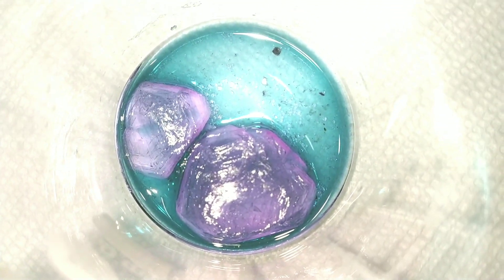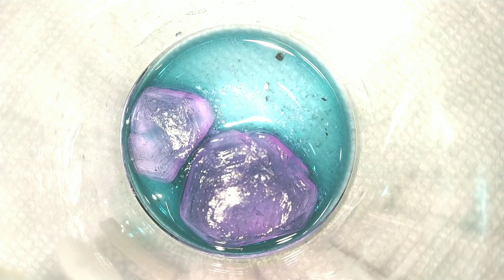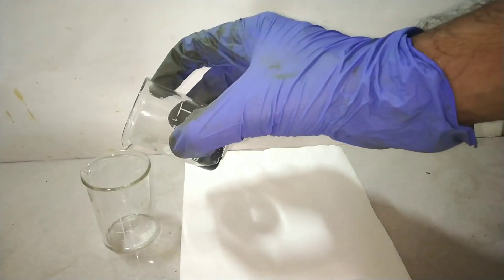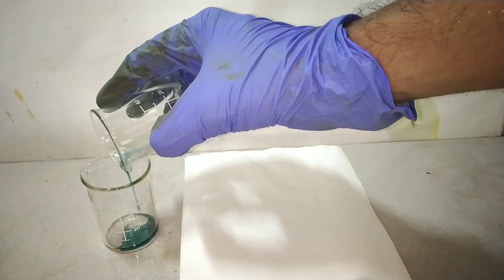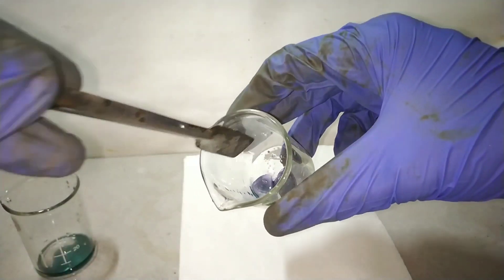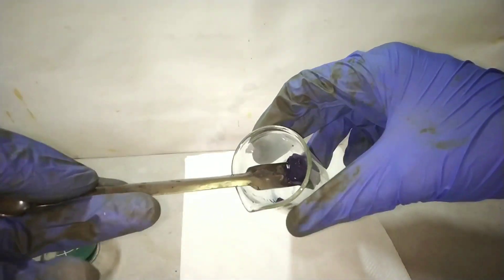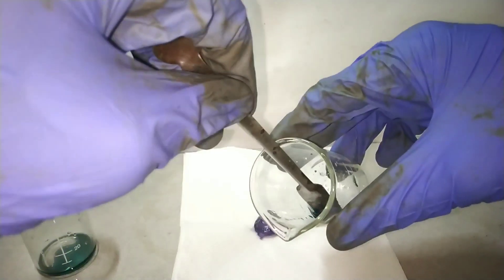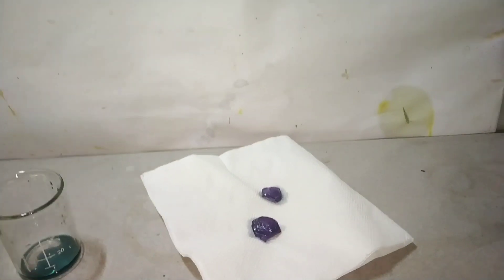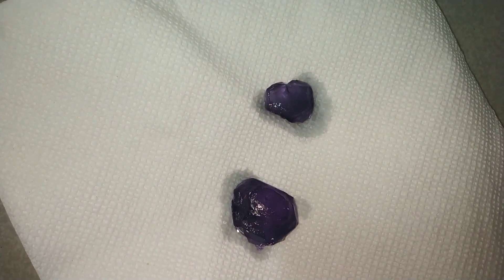The structure of the crystal is that of potassium alum, and the color is provided by the chrome alum. You can see the octahedral arrangement of the crystals and the purple color of chrome alum. The crystals formed were not in a perfect geometry because I did not hang them on a piece of thread — instead they formed underneath the beaker.